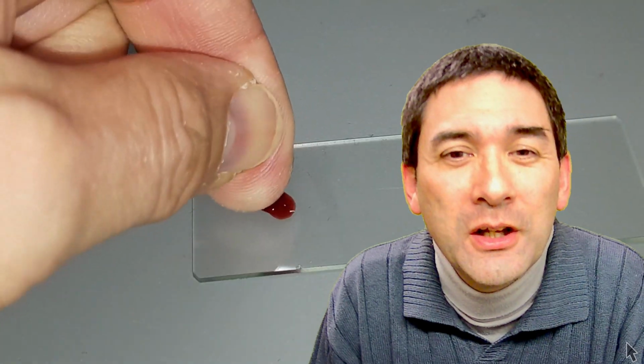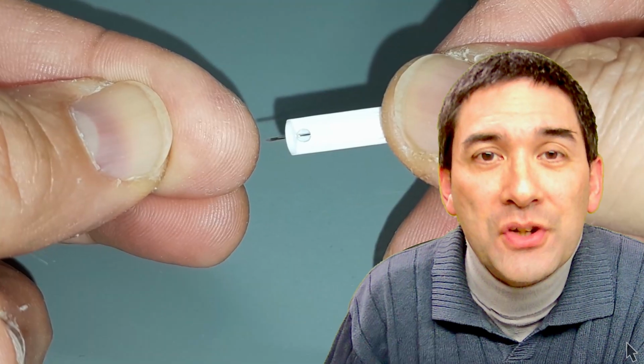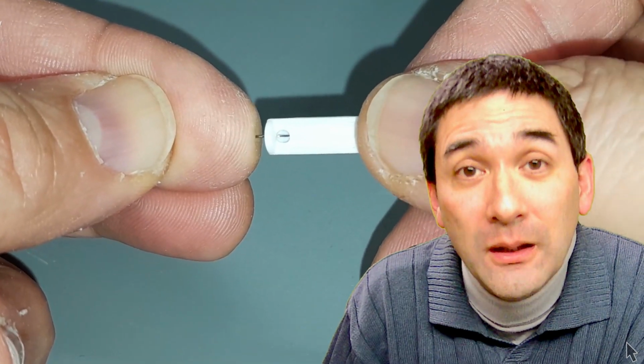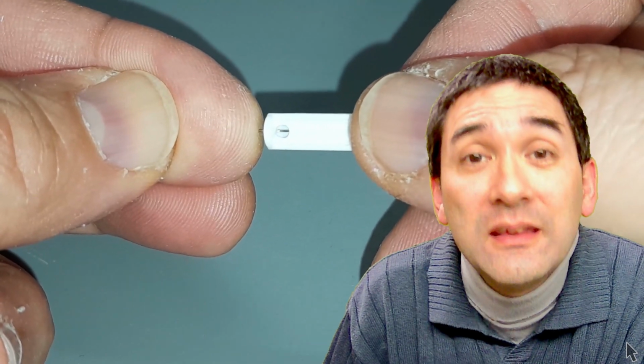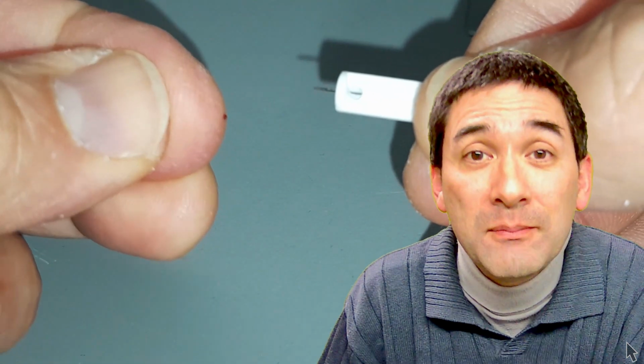You have to press very hard, and then you put a small drop of blood to the edge of the cover glass, not the microscope slide, and then you use a pretty big cover glass. I'm using a big cover glass because I want to make sure that the blood is able to spread over a larger area, because this makes sure that the film of blood, the blood layer, is very thin, and this way the individual red blood cells also become more and more separated.